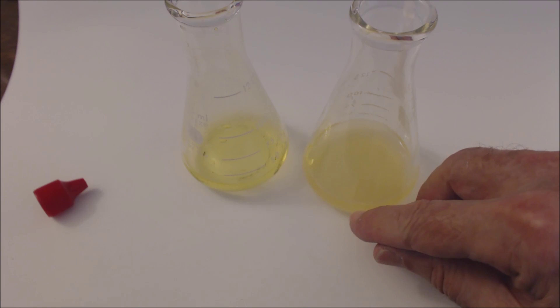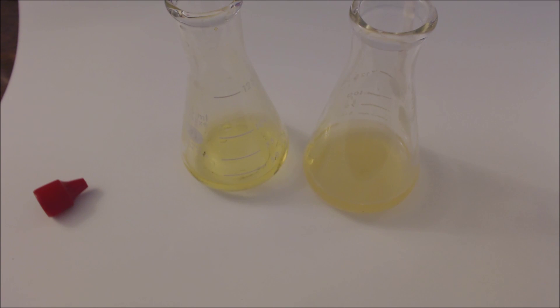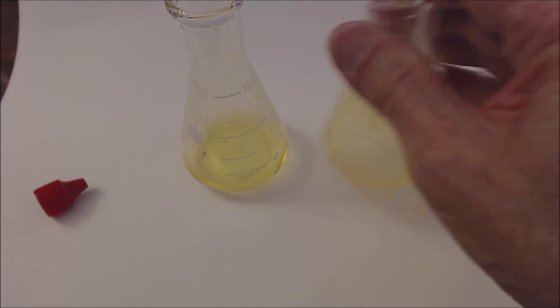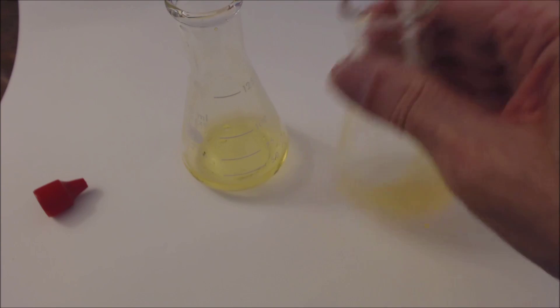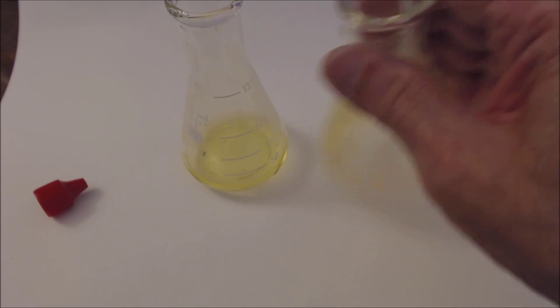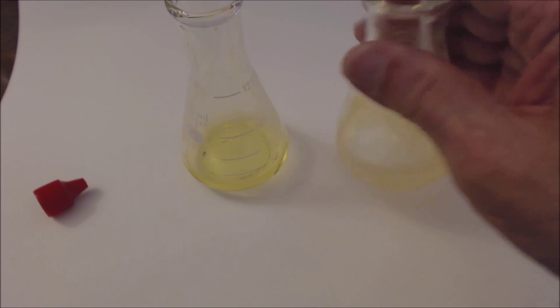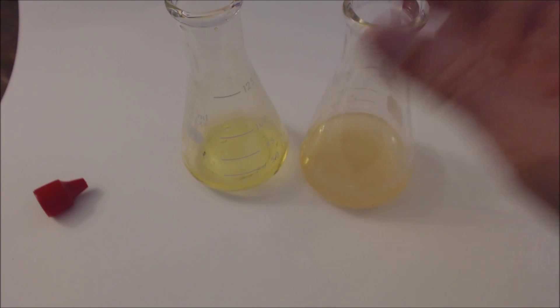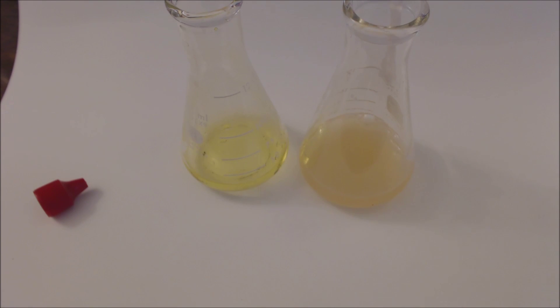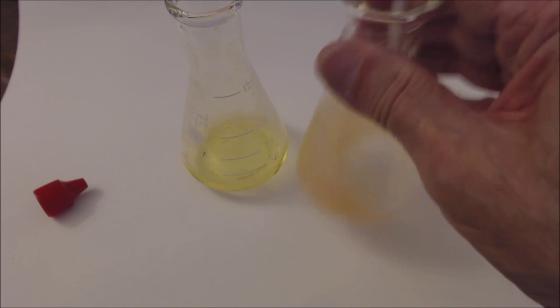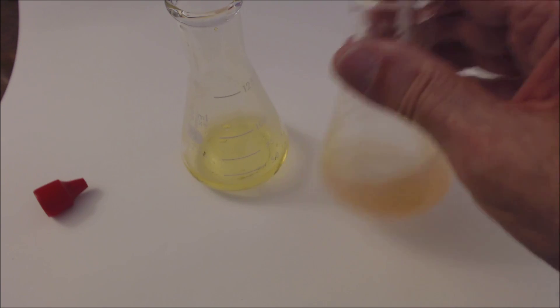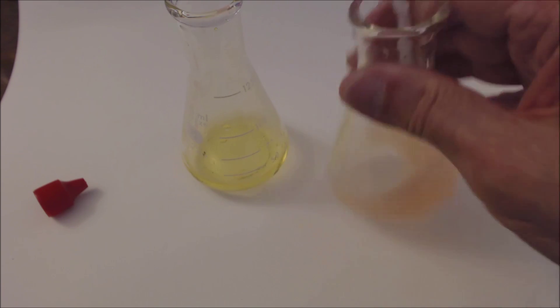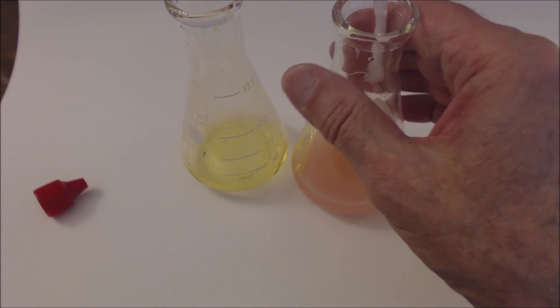I may be just imagining, but it looks like it might be a little bit, not quite as yellow. It seems like it's starting to get near the equivalence point. A little bit reddish yellow, mostly yellow, but now it's starting to change colors, as you can see. It's good to have the control. It's definitely kind of pinkish yellow.